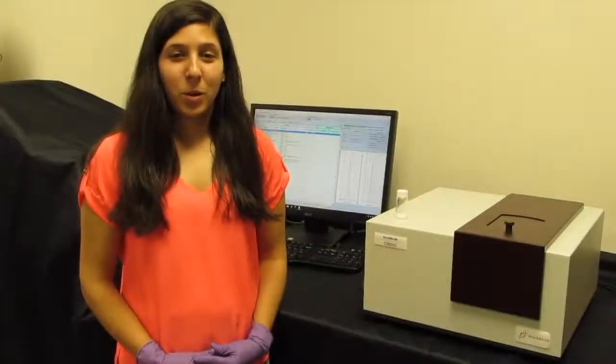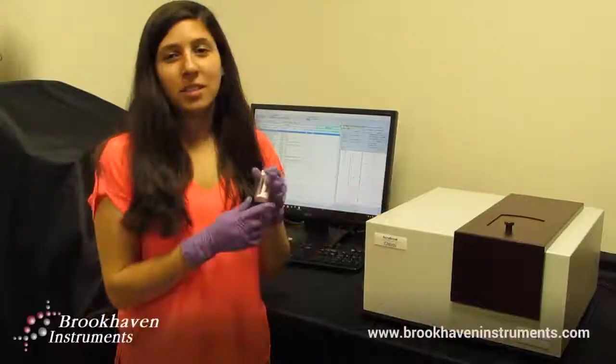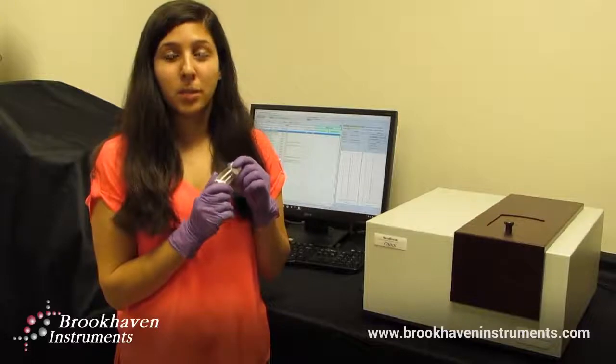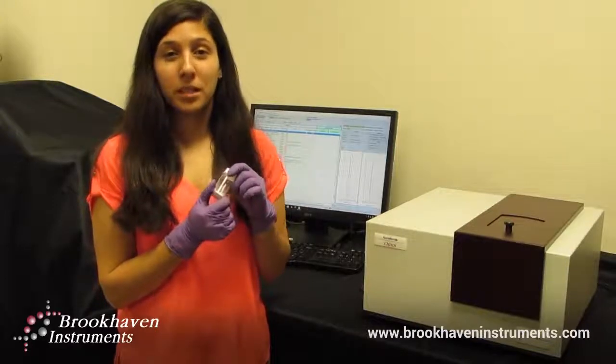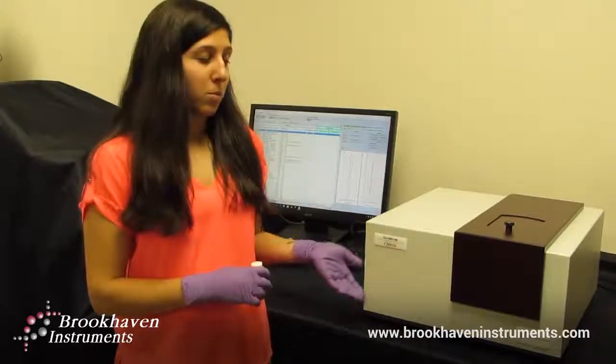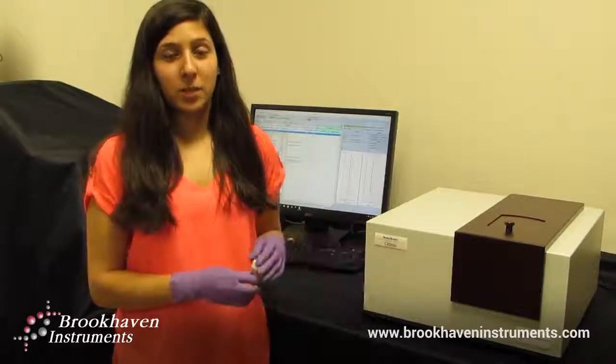In this video, I'm going to demonstrate the measurement of a micronized zinc oxide sample commonly prepared for use in cosmetics such as sunscreens, with a Nanobrook Omni dynamic light scattering instrument.